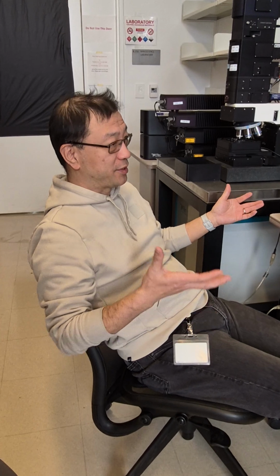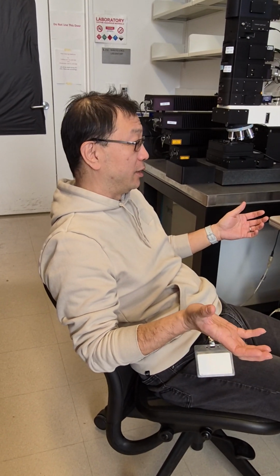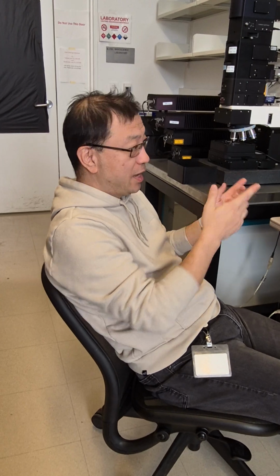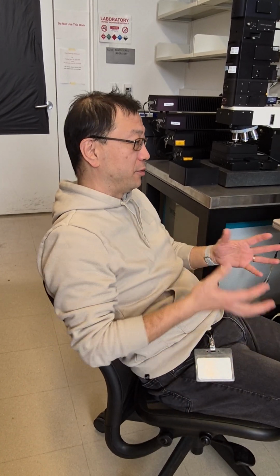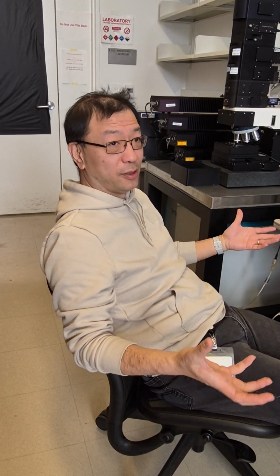And for each standard, I don't know the semiconductor. The only semiconductor I know is silicon, silicon crystal, not silicon oxide. I'll show you what the silicon you are looking for, if it's a pure silicon crystal or pure silicon wafer. But other than that, I don't know much about semiconductor. You must do your own homework.